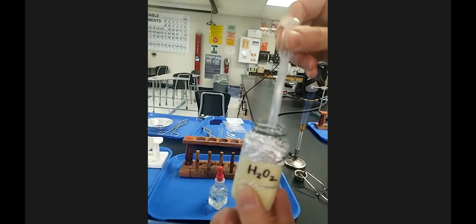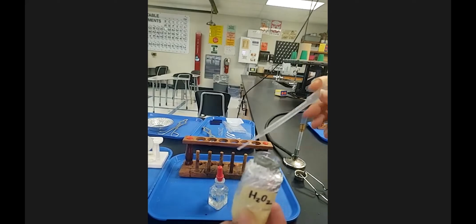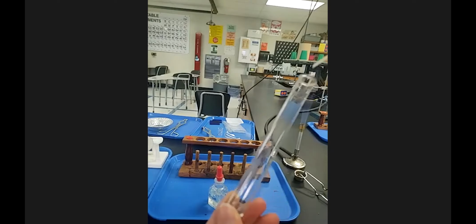So I'm going to pull it out so you can see it is just a translucent liquid. But if you have hydrogen peroxide at home and it's in like a brown bottle, again to try and make it so that it's not exposed to the light because it's light sensitive, or it reacts with ultraviolet radiation. Same with milk. Milk will spoil faster, and that's why milk is kept in the dark. Those containers that milk is in, if you've ever noticed, are typically opaque.